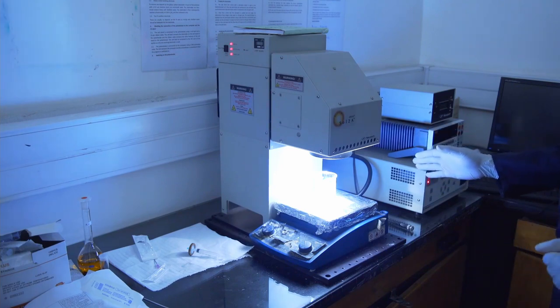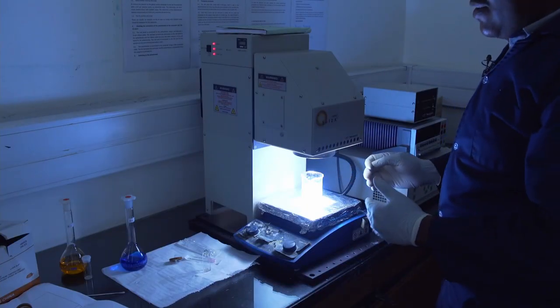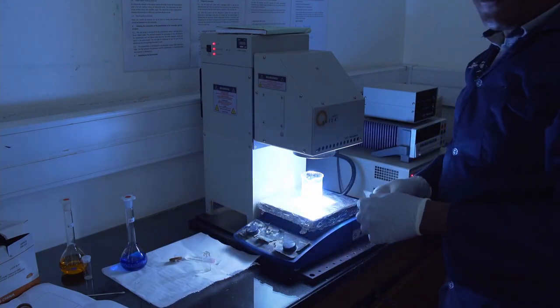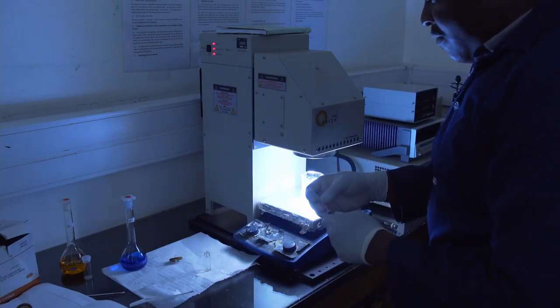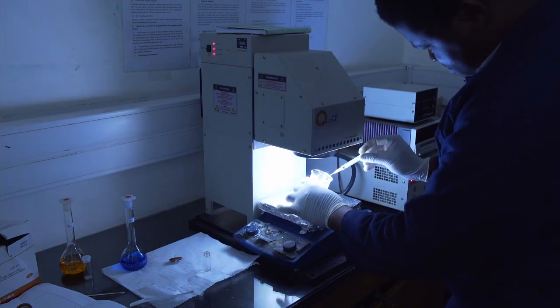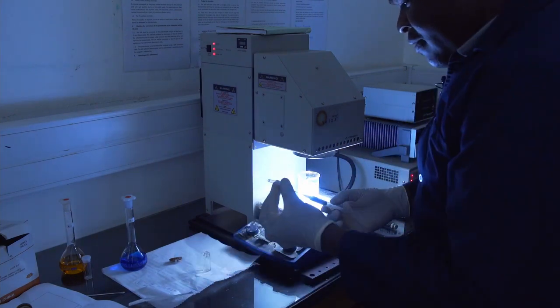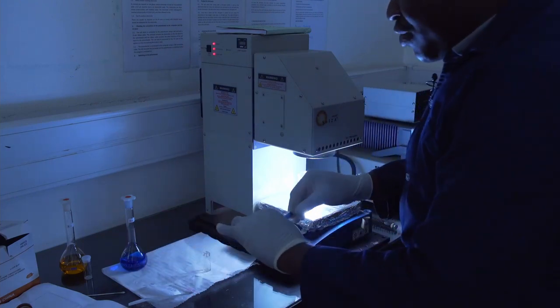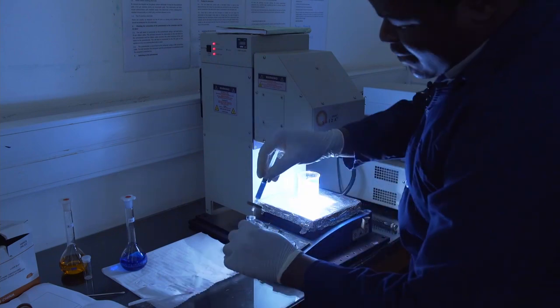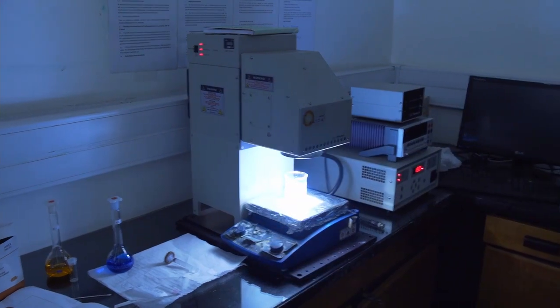The sound you are hearing is from the solar simulator, and this experiment will be done at 10 minute intervals. After the 10 minutes photodegradation, we then take an aliquot of the sample for UV-Vis analysis. A microfilter is used to remove any residual zinc oxide photocatalysts, and thereafter the sample is taken for UV-Vis analysis.